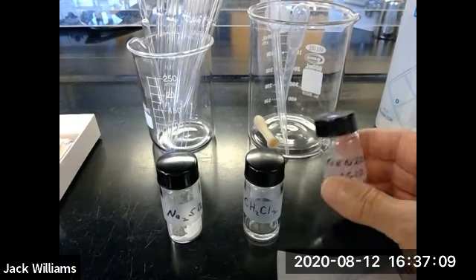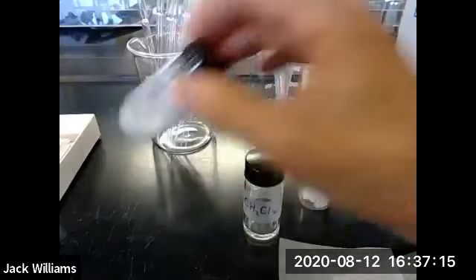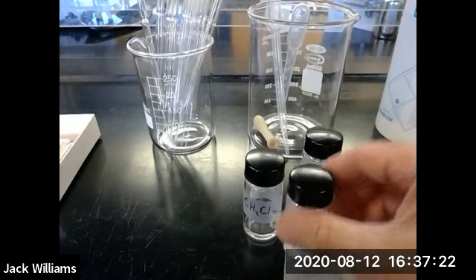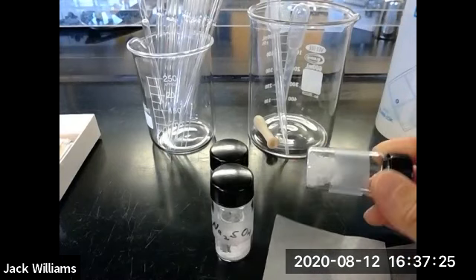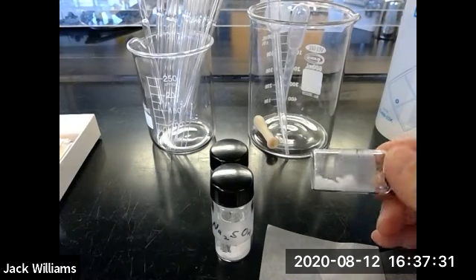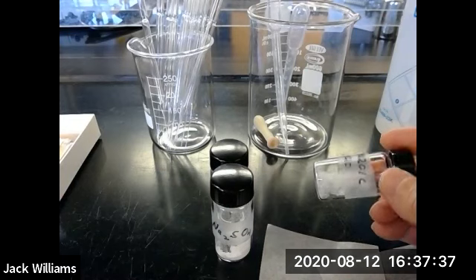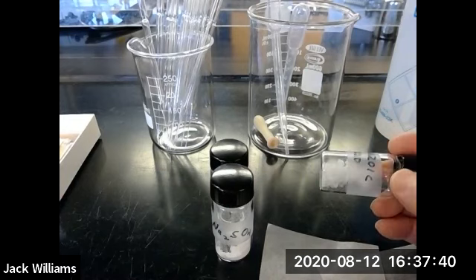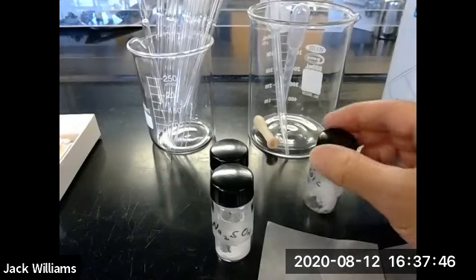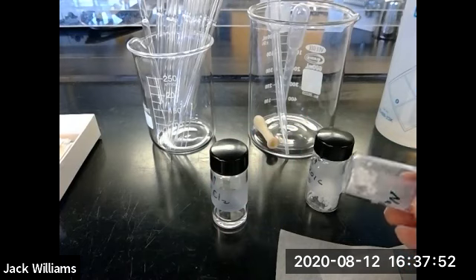Here's one of the chemicals, benzoic acid. And you look at this, and you notice that it looks different, obviously, than this one. So this is kind of powdery. It probably has a pretty high surface area compared to this one, which is kind of chunky or granular. We say it's granular in nature. So now what this means is that when you weigh the benzoic acid, even though you're only going to use, I think it comes out to be 40 milligrams, you're going to have to calculate it. One of these chunks in here is probably a good 25 milligrams, so it's not going to take much, as opposed to something like this. You're going to have to use a little bit more of this as compared to benzoic acid.